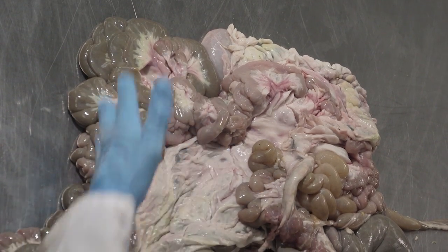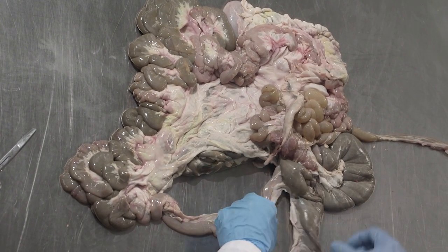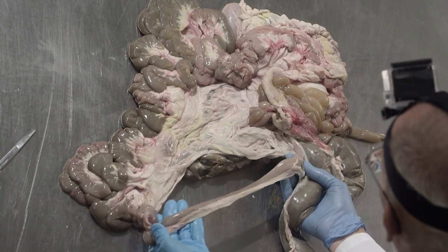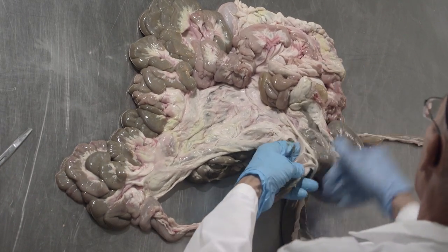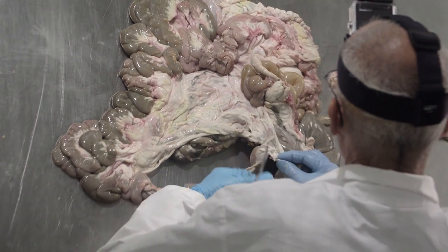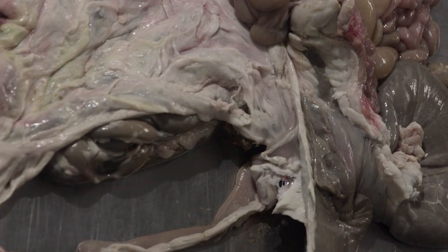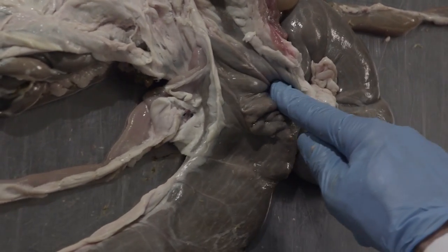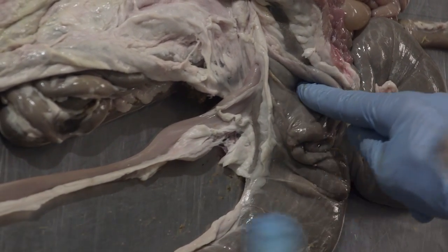And then eventually we pass through the small intestine, digest the nutrients that are there, and then we get down to the large intestine. And so the last part of the small intestine, again, this is called the ileum, and it empties into the large intestine complex, just like we saw in the pig. And it does it at the junction between the cecum, which is this blind-ended pouch here. So that's the cecum. And you can see the ileum then coming in from the small intestine right here. This is cecum.